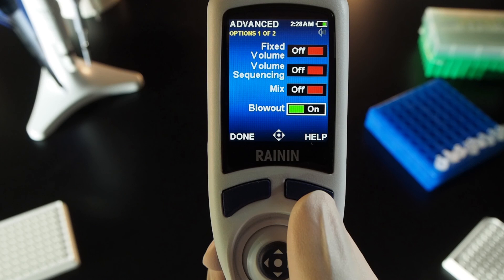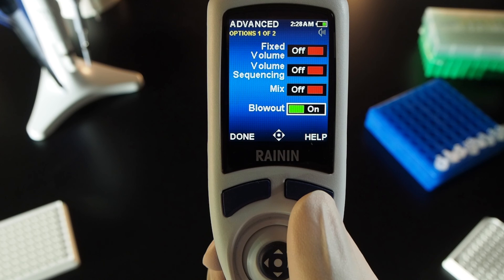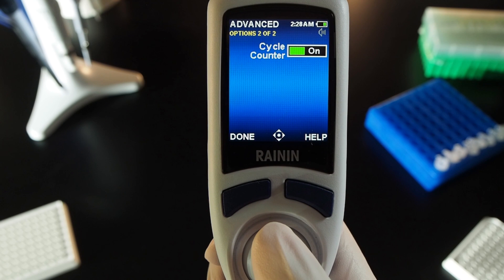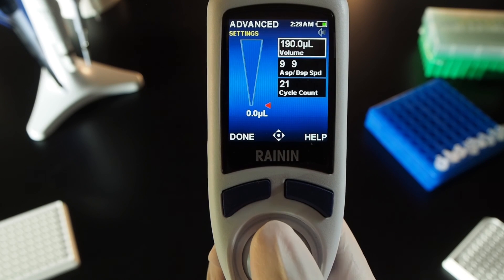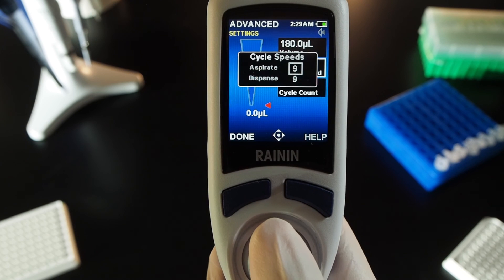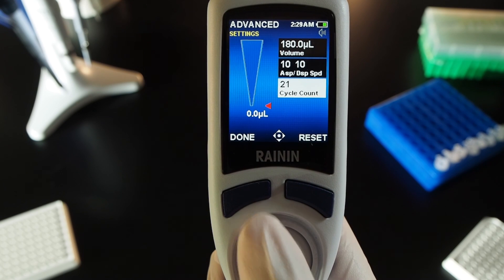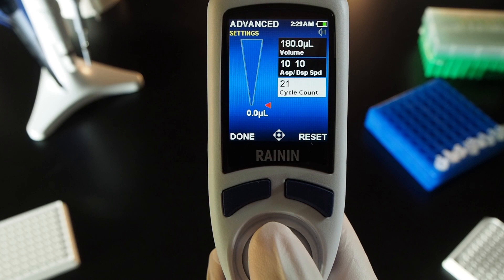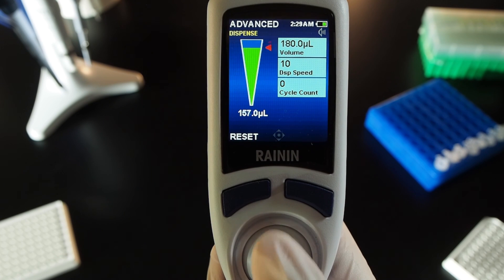Turn the cycle counter on or off. Use the cycle counter to let the pipette record progress during an experiment. In options, joystick down to the second screen of options. Press the joystick in to turn cycle counter on. Press done to exit and joystick right to go into settings. Adjust volume and speed settings as you wish. Joystick down to the cycle count box and press the joystick in to adjust the setting. You can use the joystick to change the number or press reset to set the cycle count number to zero. Aspirate and dispense and notice the cycle counter registering each cycle.